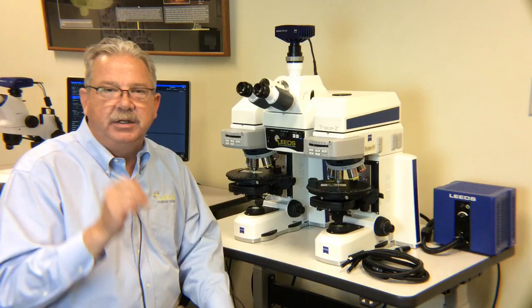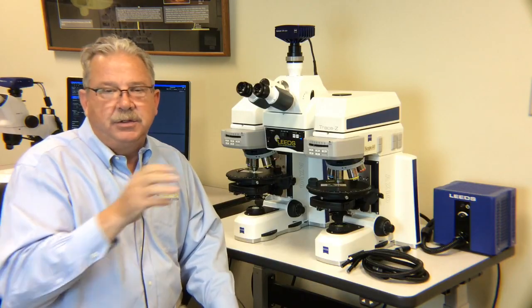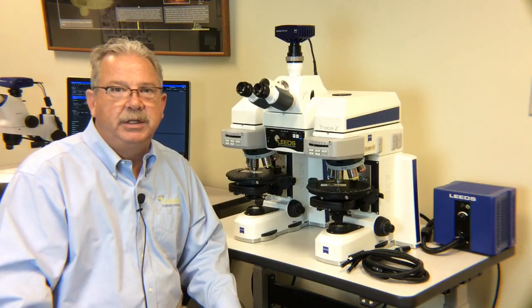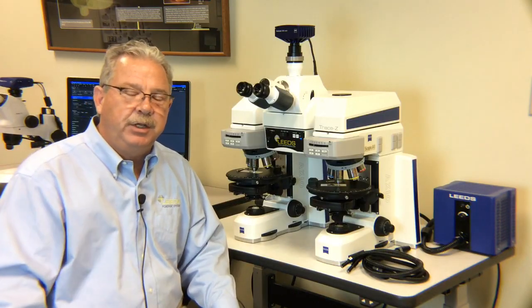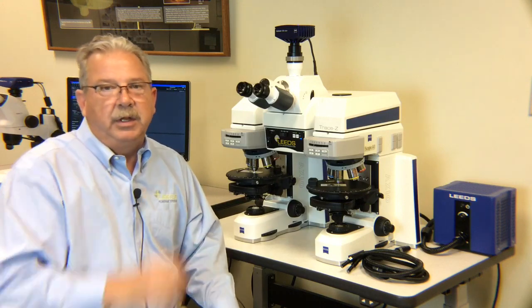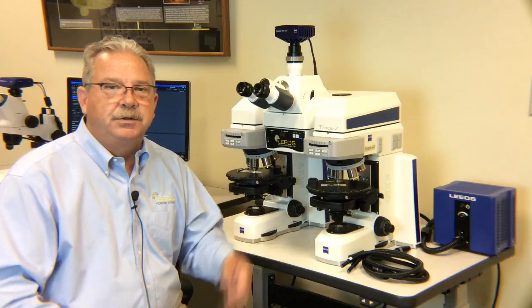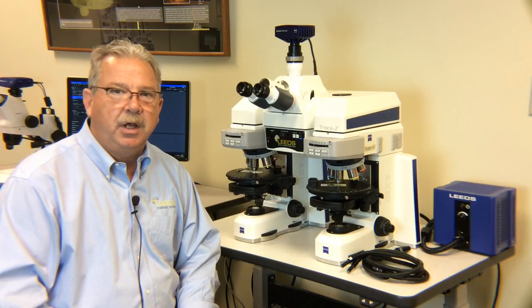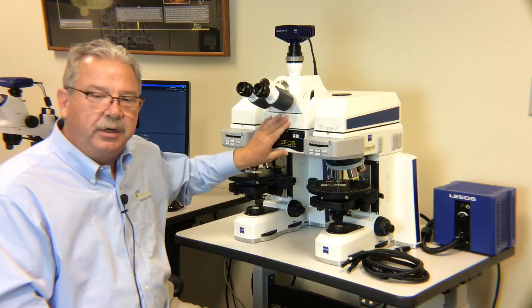Actually what we find is the examiners like to work with no knife edge there. The two images seamlessly blend together, but then when they're going to take pictures and try to explain to people what they're doing, they like to dial in a little bit of a black edge in between the two, so it's very easy to quickly recognize that they're not the same image. We can look at this a little bit more in depth in our discovery video.